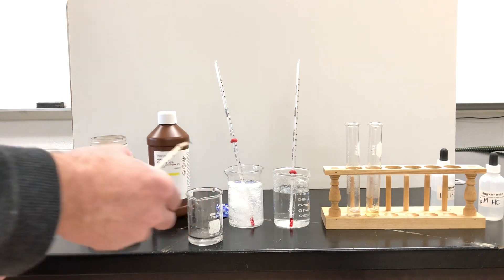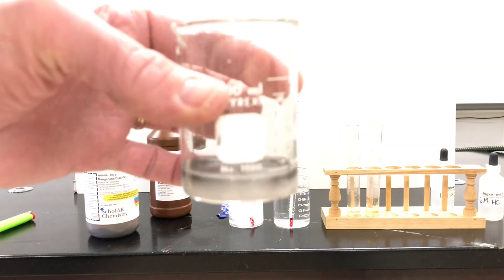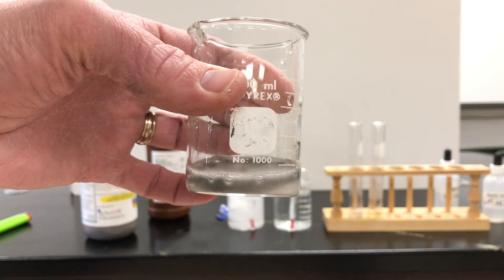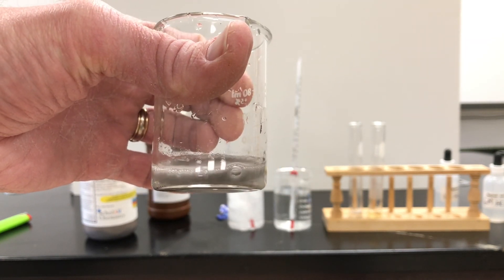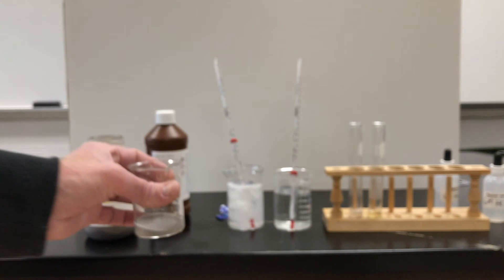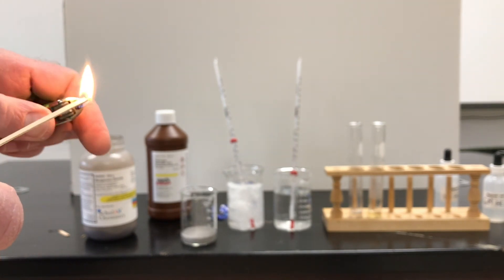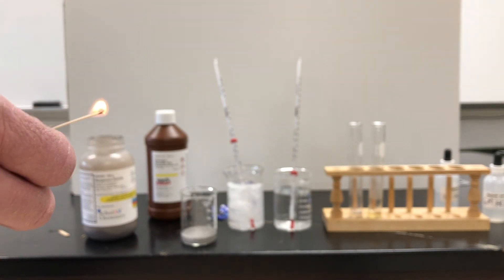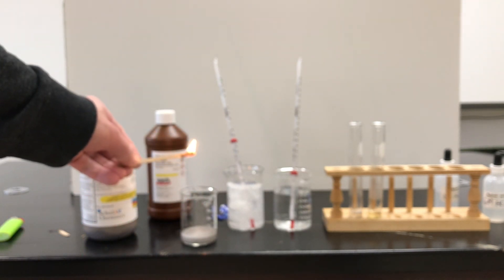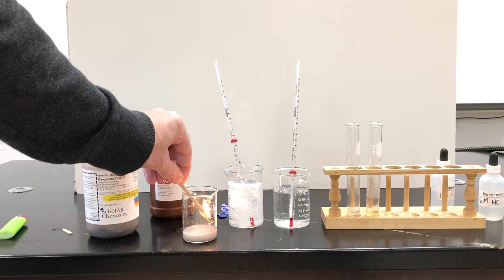Suddenly you'll notice it's bubbling quite a bit, giving me oxygen gas. That's oxygen gas coming off there. I know that it's oxygen gas because oxygen gas helps burning. So if I light my splint on fire and put it into this beaker, it should make it burn brighter — and it does.